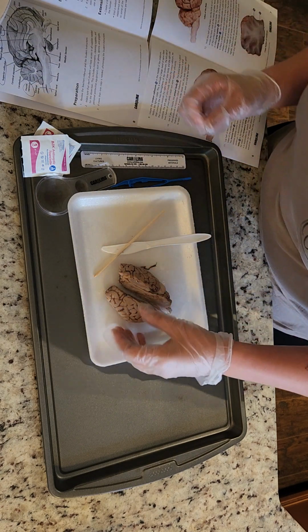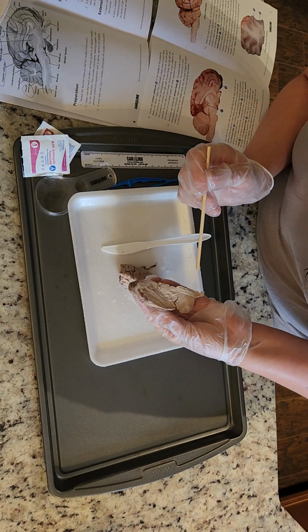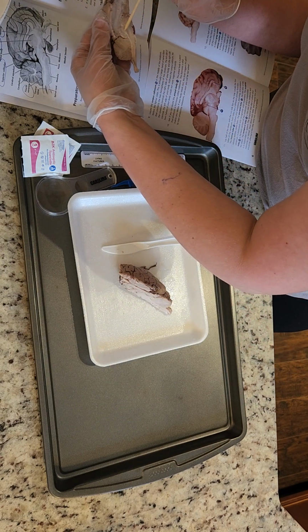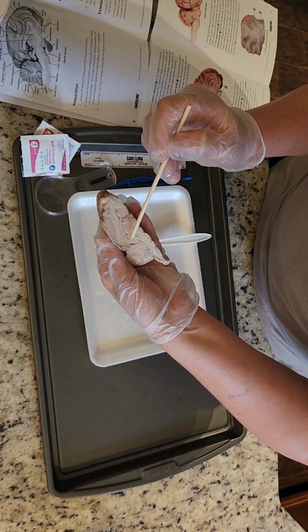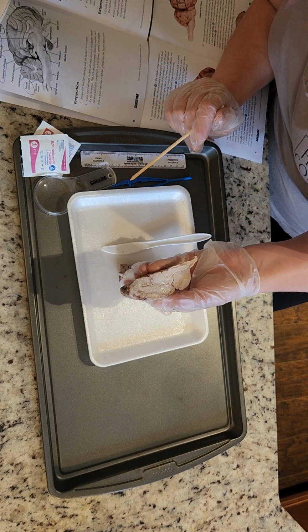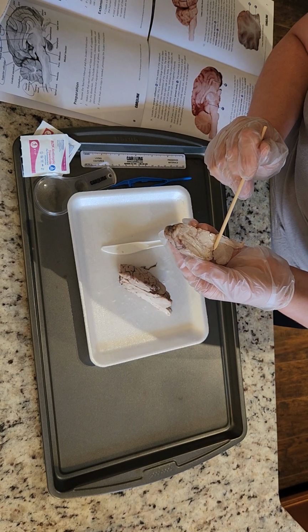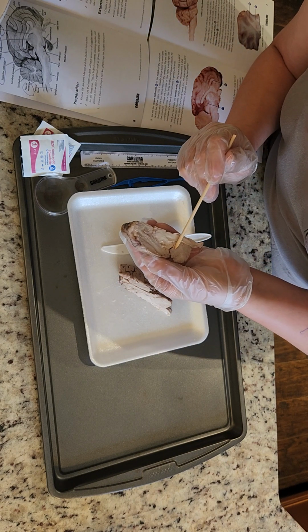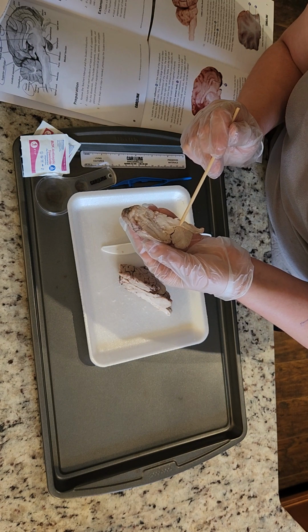And then we have the thalamus, which is right here, actually. So hopefully you can see that okay. That's the thalamus. And again, I'll have some pictures. The third ventricle, or one of the ventricles, is right here. Let's see, corpus callosum.